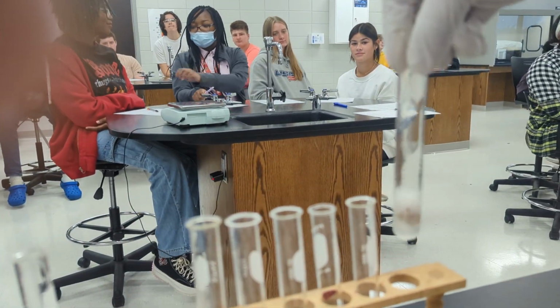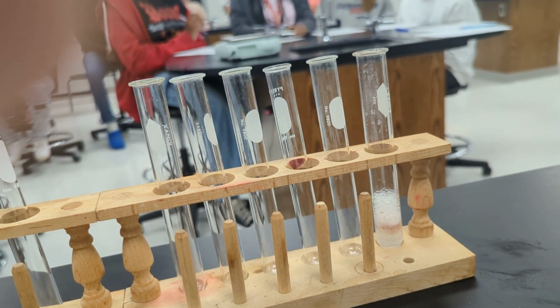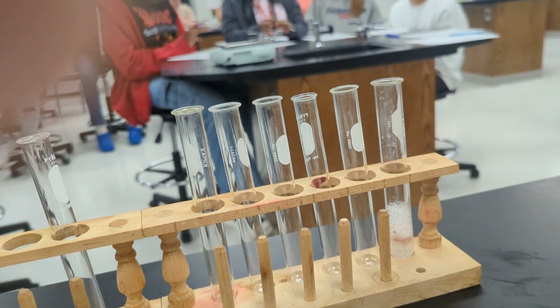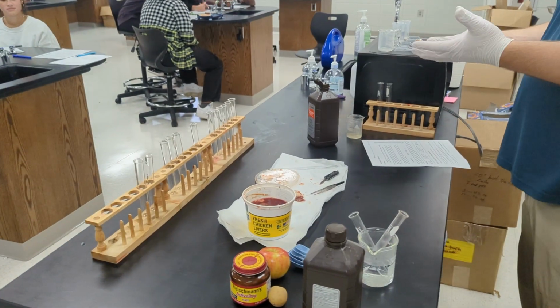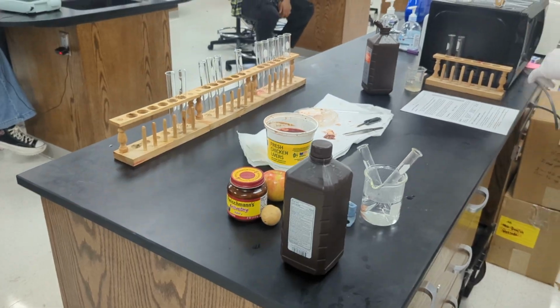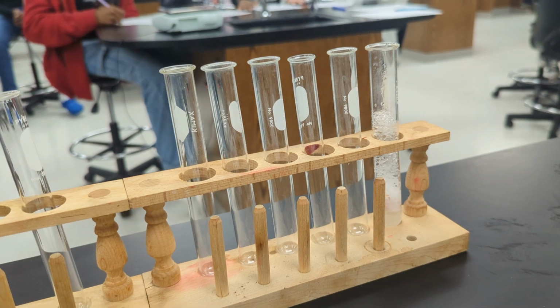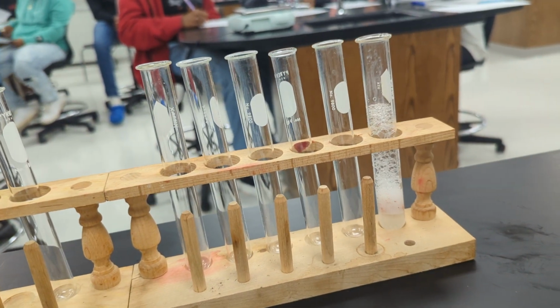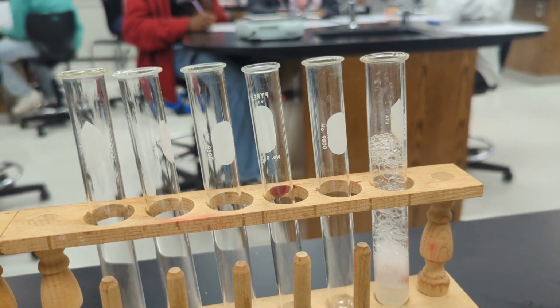Right? So yeah, it's breaking down the peroxide and producing oxygen, all right, and water. So water's still in the test tube, and the oxygen that's being released, where's it going to go? It's the only places you got. What gas is being released? Refer back up to the reaction. You can either write it out or you can use the symbols if you want to.